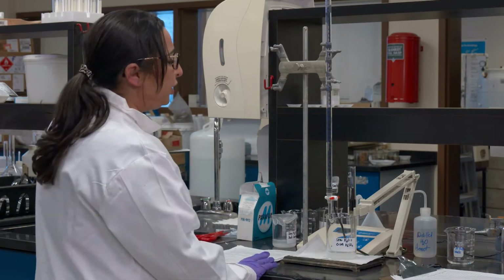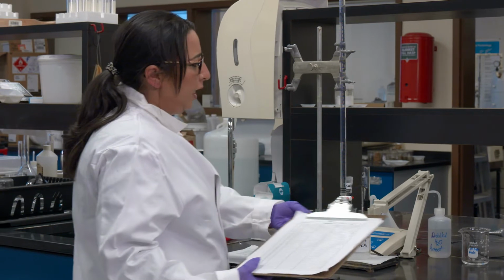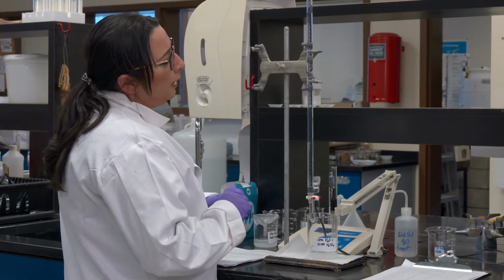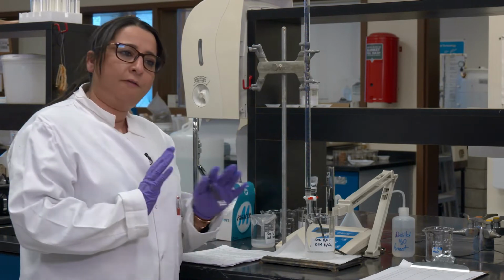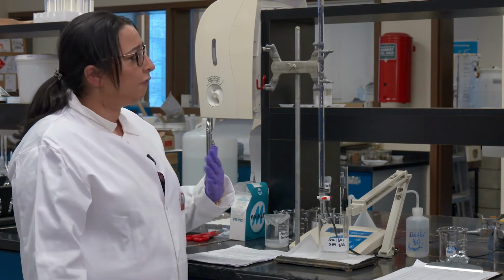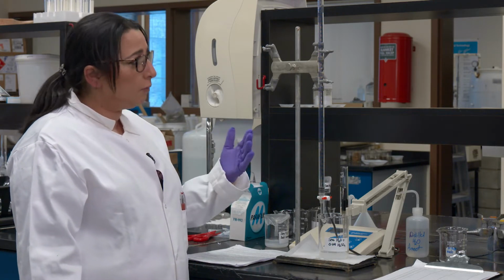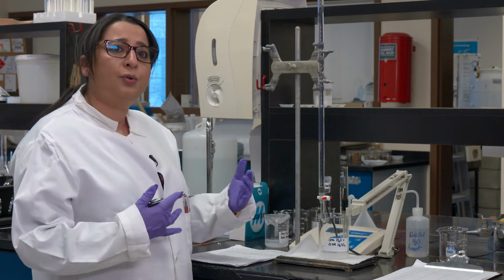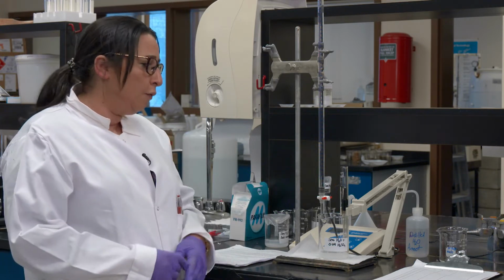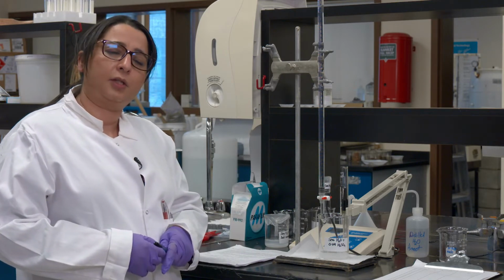So I'm just going to start. The way I'm going to take the reading, I'm going to set up my pH, the volume that I'm going to add in the burette. To start with, you have to come up with whether you want to add 1 ml, half ml, or 1.5. I'm going to start adding 1.0 ml and see how it goes in terms of my readings for pH. And then if we have to change, we can always go up and down a little bit depending upon the set of readings I'm interested in.